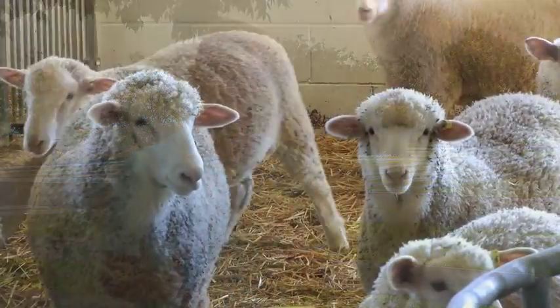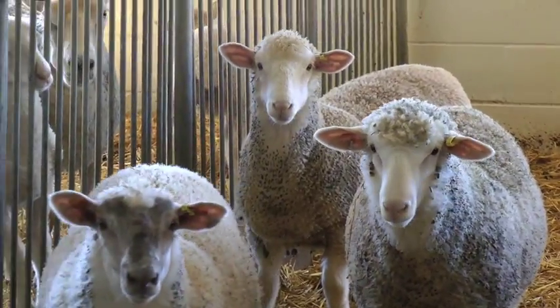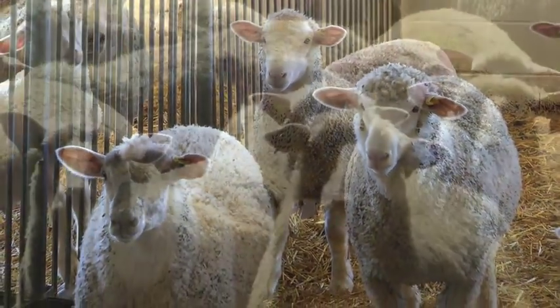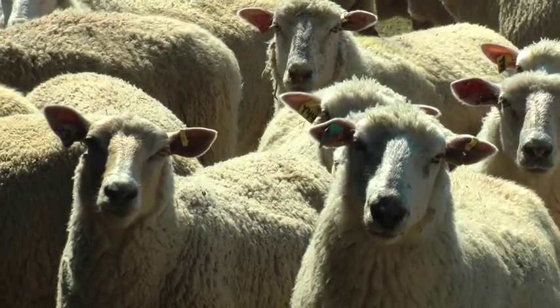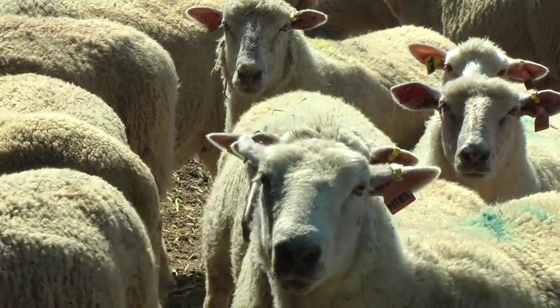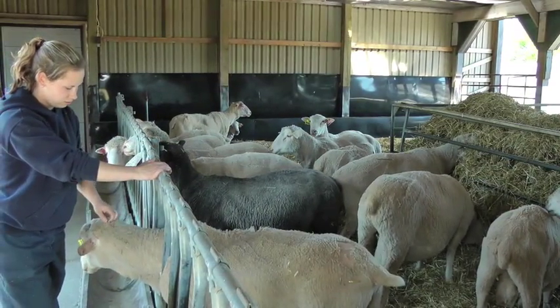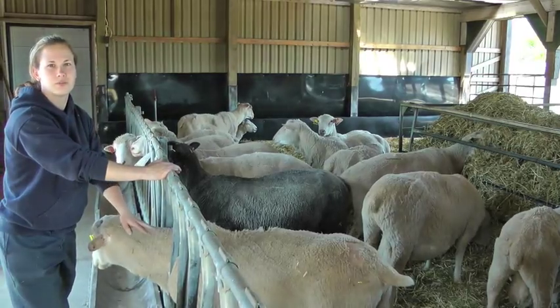However, other times, the sheep may not even show any clinical symptoms, even if it's carrying large amounts of the parasite. Since the adult parasites in the sheep lay eggs, veterinarians need to be able to count the number of eggs in the animal's feces in order to get an indication of how many parasites are in the sheep. That's why today, we're going to show you the best techniques for collecting fecal samples so that you can better detect and treat parasite infections in your flock.